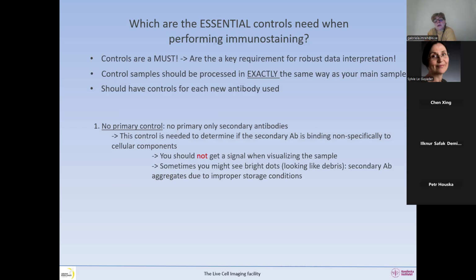Sometimes you might get some bright dots, looking like debris, hopefully both in your sample, but also outside your sample. And I would say that those are secondary antibody aggregates, which can occur due to improper storage conditions. This is when I recommend that you take the vial of the antibody, vortex first, spin it down, and just take the supernatant and then use it.